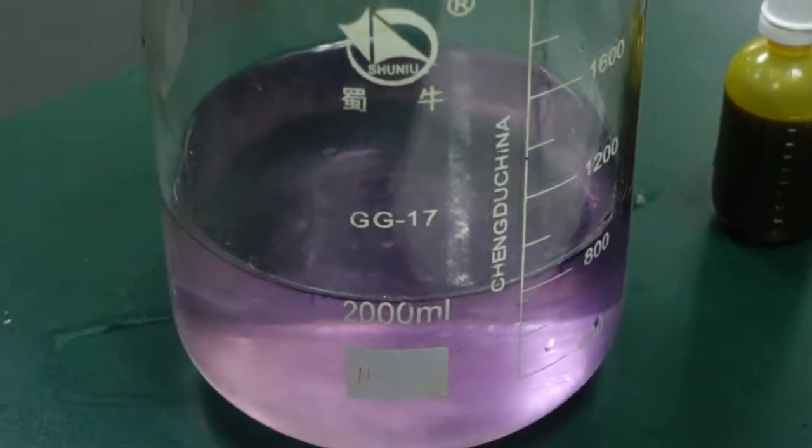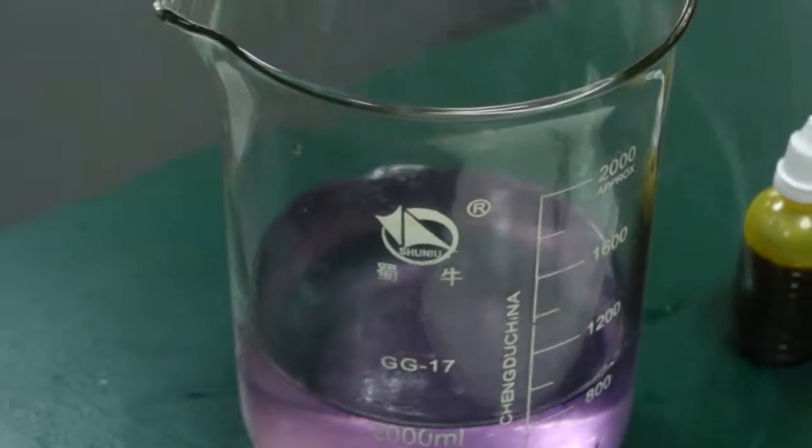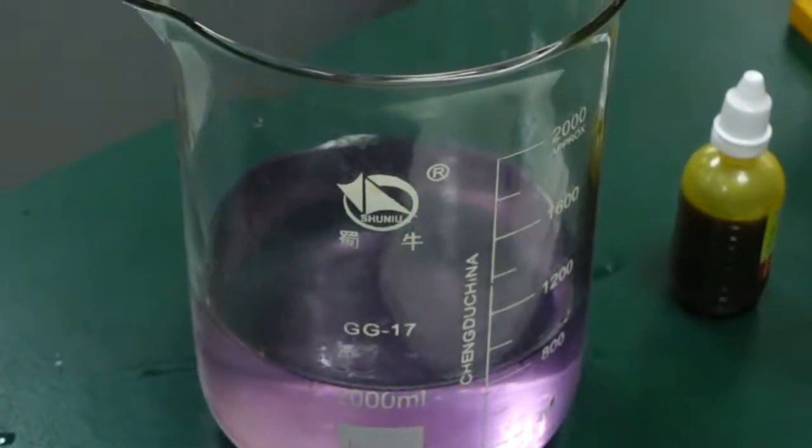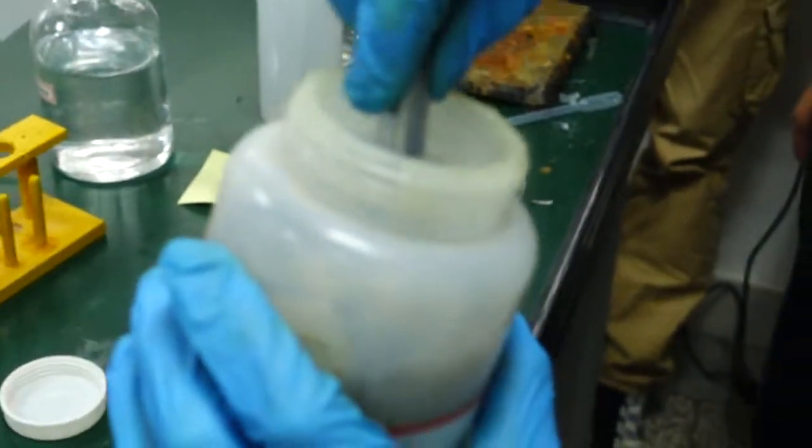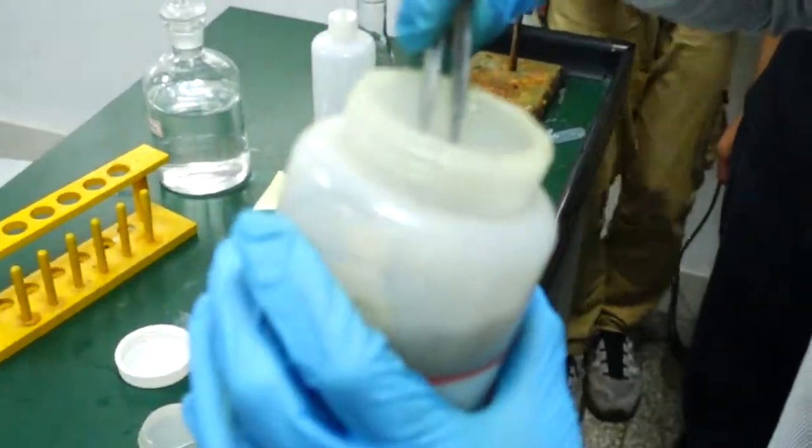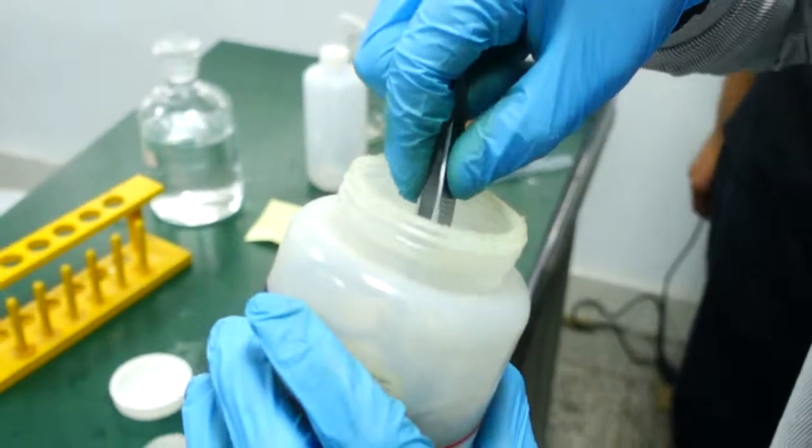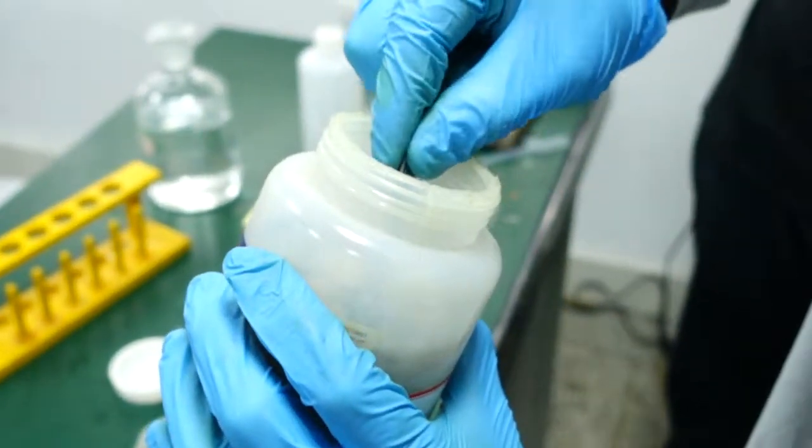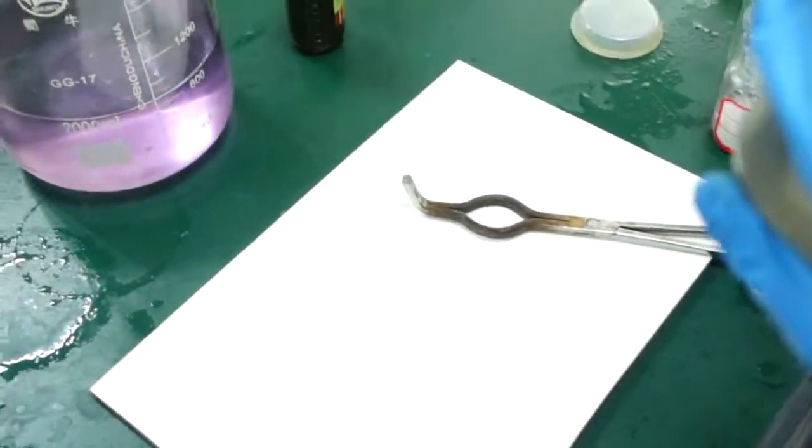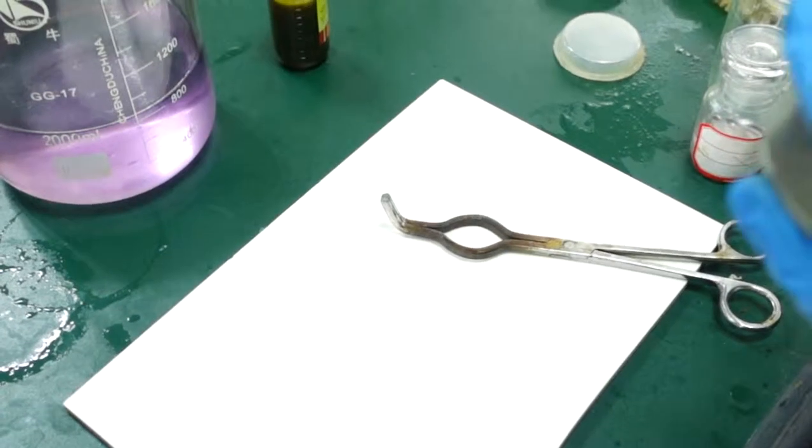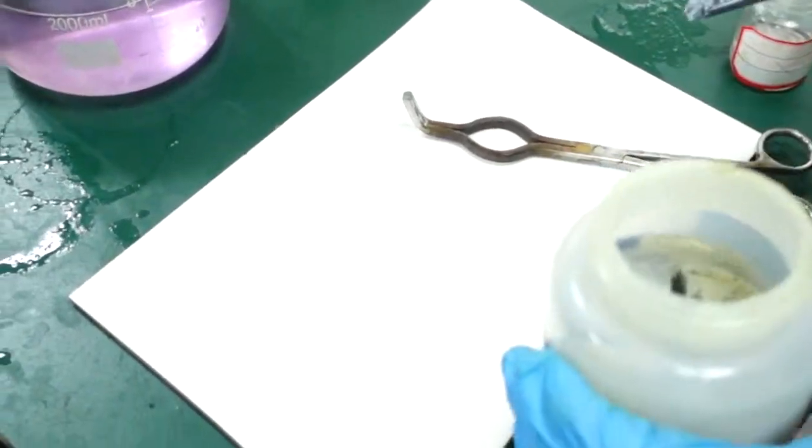Metal Y - we have a huge amount of it. I've never seen this amount, a whole jar! I'm not crazy enough to put the whole thing in. I value my life. But it's so soft, I can just pull it off using the tweezers. Very soft metal. Wow!